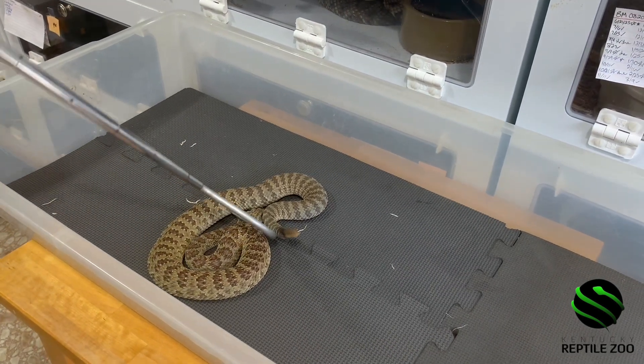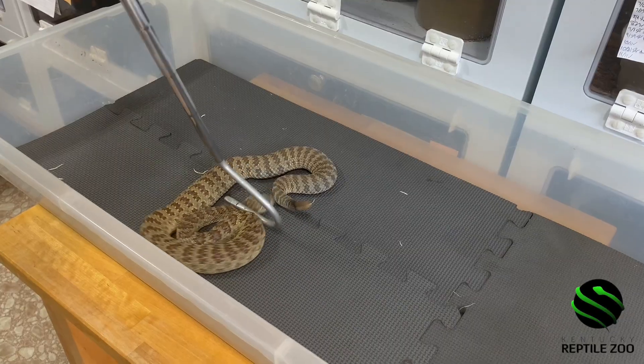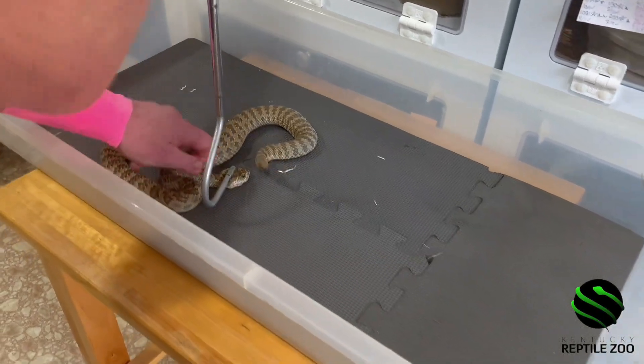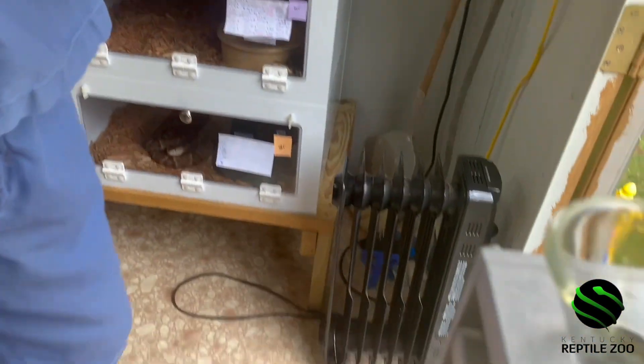You can't put your finger on it. You have to get it like this where there's a little distance in there. That's how a lot of times people get it pulled off their fingers.